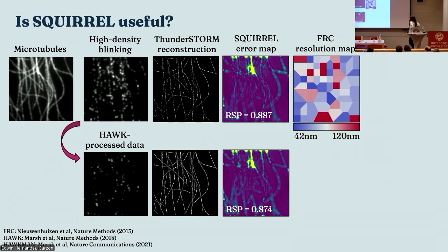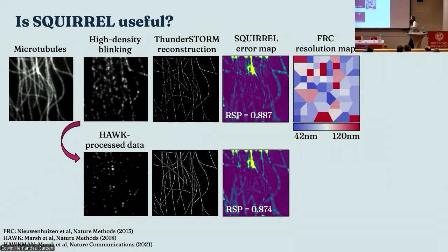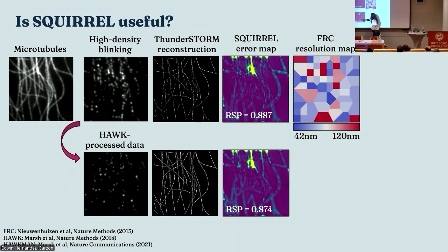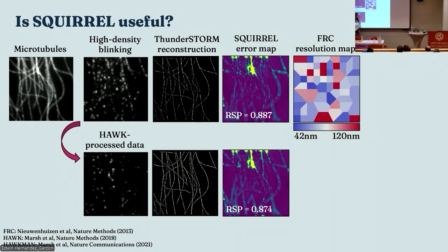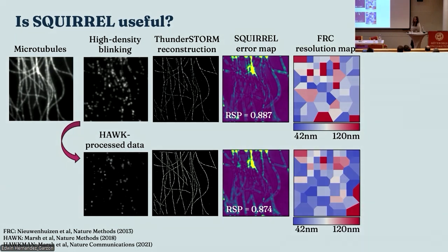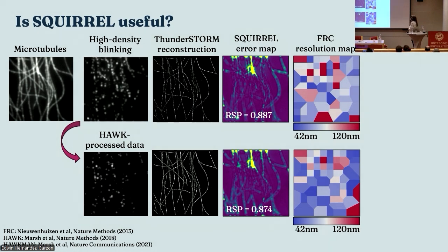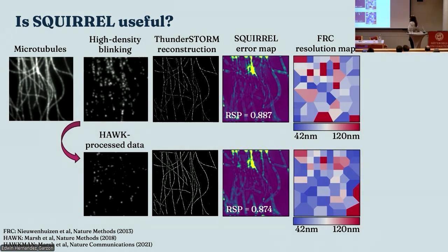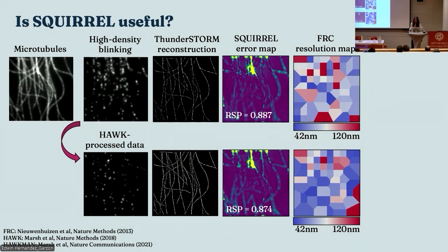Okay? It's worse because SQUIRREL is very good at telling you where things are linear with respect to your diffraction limited data, but not necessarily some of the structural things, which is not great, right? It's saying there's error here where it's quite good, but that's because we were just brighter in our original image, and that hasn't been picked up by the super resolution data. And again, our FRC map is telling us a fairly similar story, right? So this is to say that SQUIRREL is kind of useful, but take it with a pinch of salt, all right? It seems to work for quite a lot of things, but sometimes, depending on the algorithm you use to reconstruct the data, it just doesn't work that well.